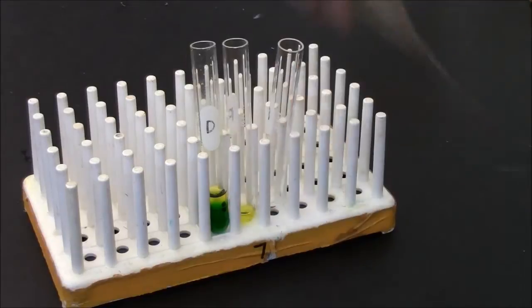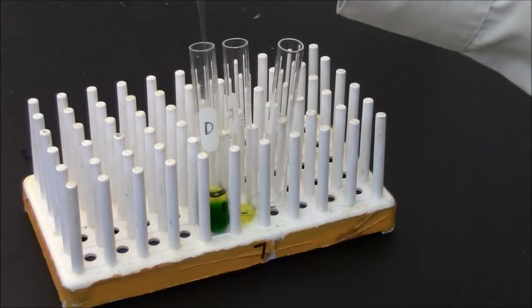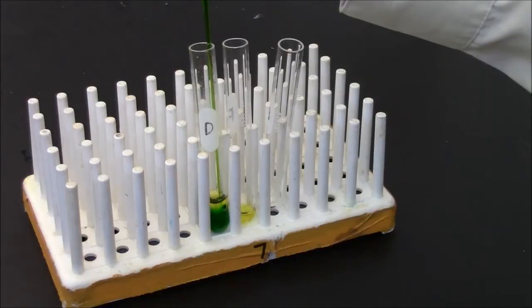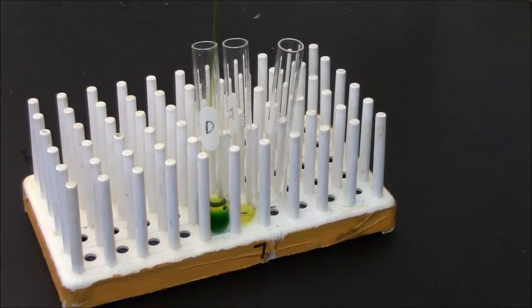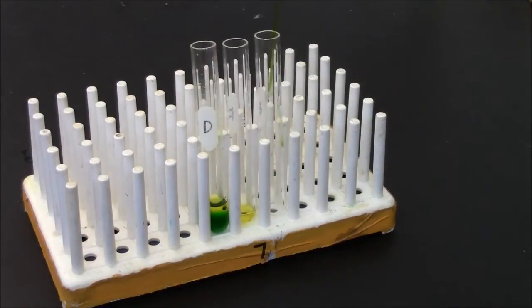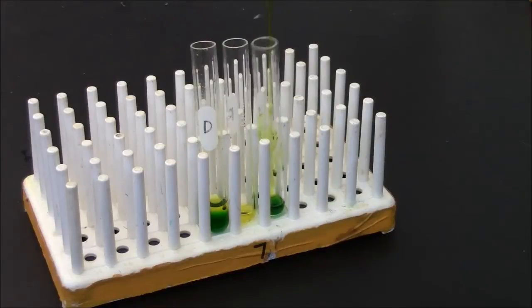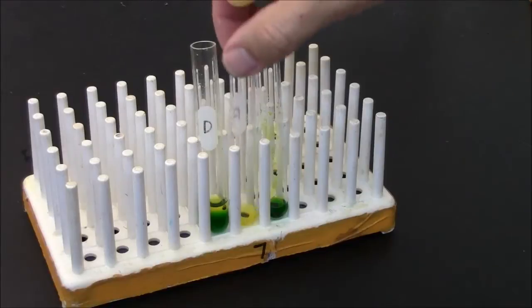Here I'll now show, I'll try to get only the green now. So push my pipette all the way to the bottom, pull up the green layer. There's fairly pure green layer, there's fairly pure yellow layer.